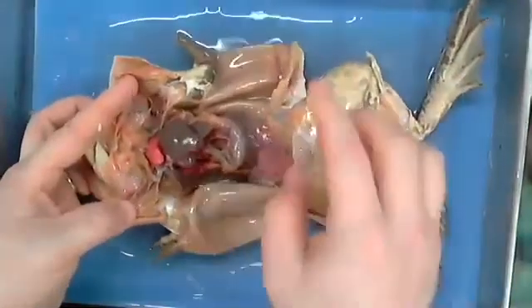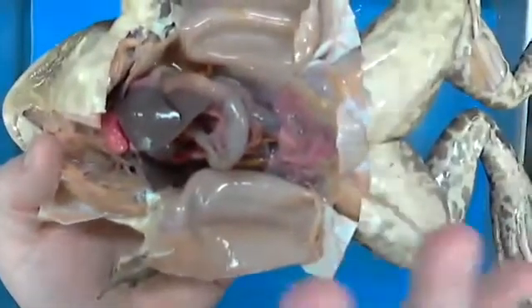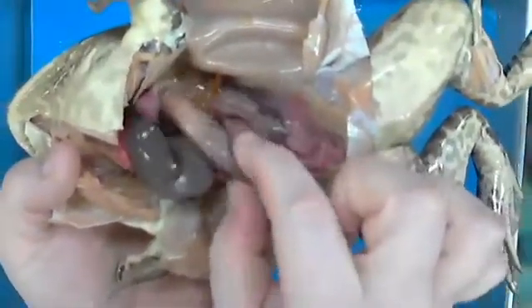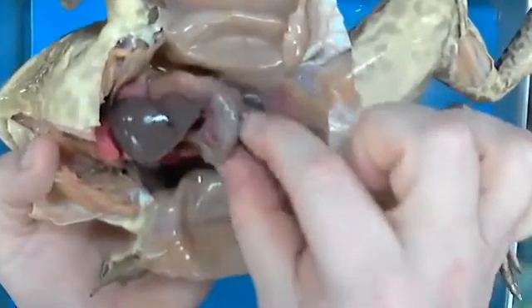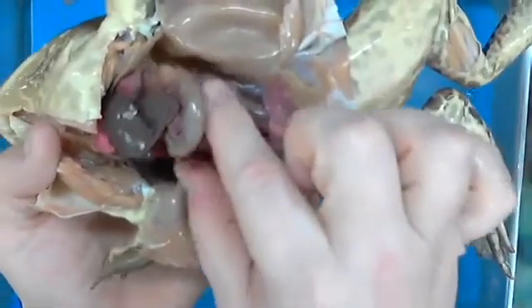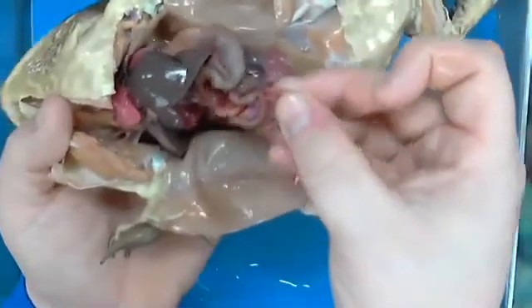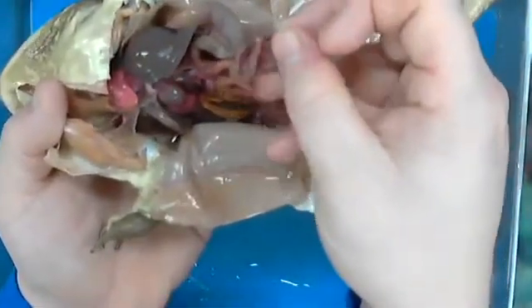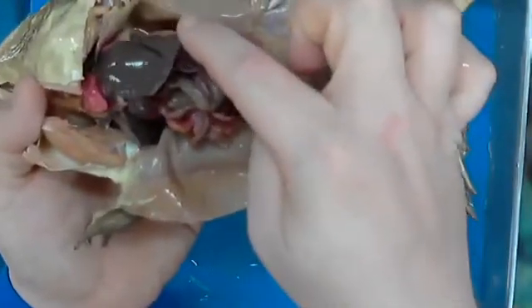All right, so let's just take a quick gander at some things, and we'll see if I can get us a little bit closer, okay? Let's see if we can take a quick gander at some things and just immediately be able to pick them out. What do you think this right here may be? Liver. Let me give you a hint. It's also attached to all of this stuff. Stomach. All right, so perfect. This is his stomach, okay?